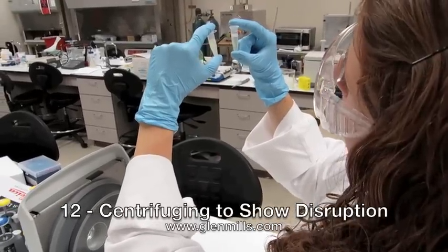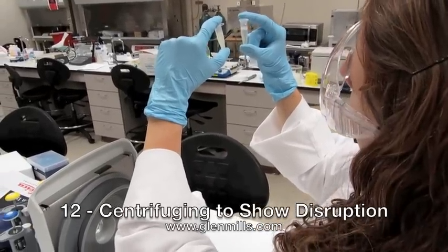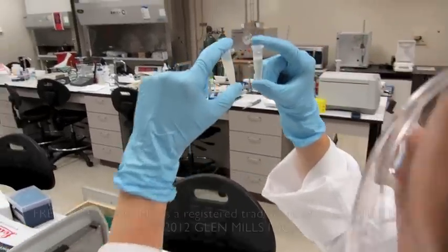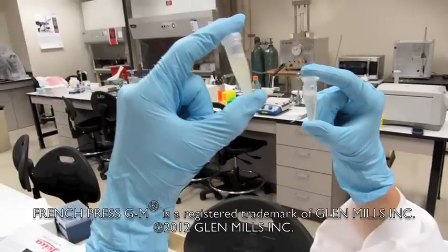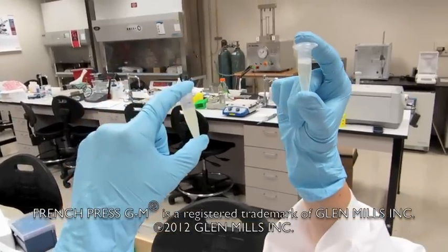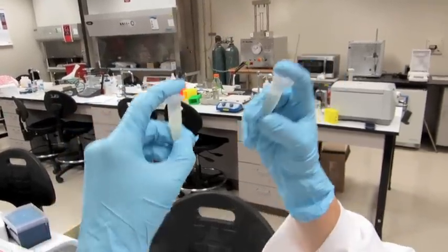The amount of lysis can be analyzed by centrifuging the samples. The sample on the left is before lysis, and the sample on the right is after lysis.